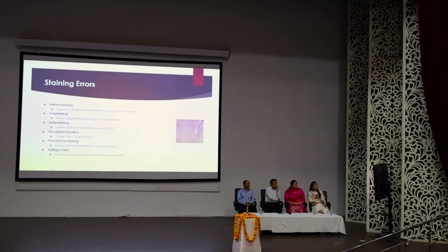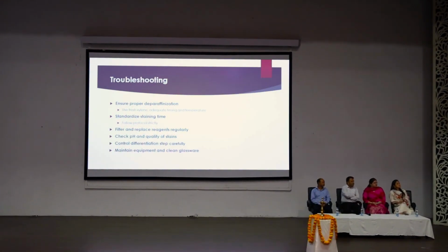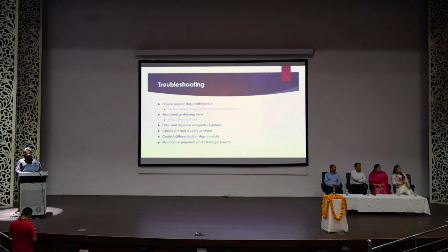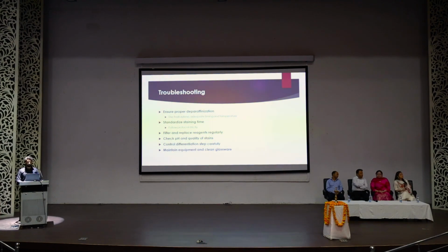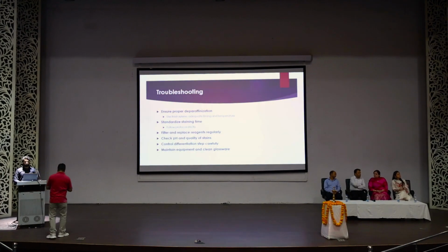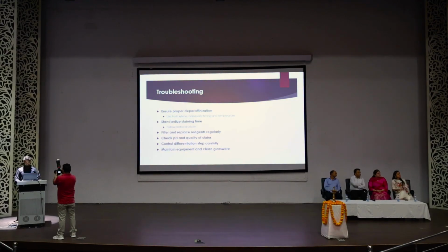You can see the image here. This is because of the retention of wax here. We cannot see a clear image in this section. Now the troubleshooting for this problem is, for proper deparaffinization, use fresh xylene, adequate timing and temperature, especially during winter times. As I said, the temperature here in Jammu is below 15 degrees Celsius. So for this, we are using a trough containing xylene, put in an incubator at around 45 to 50 degrees Celsius. Then the deparaffinization happens there.